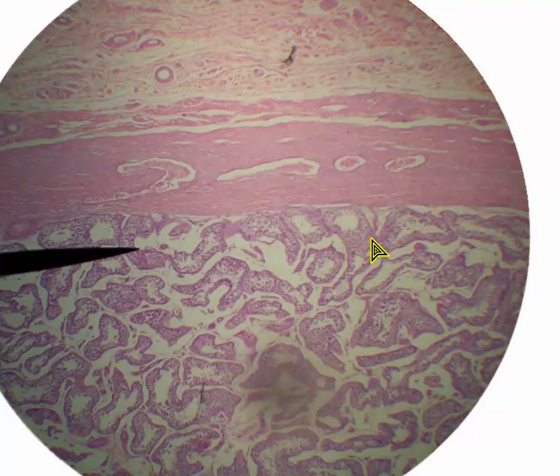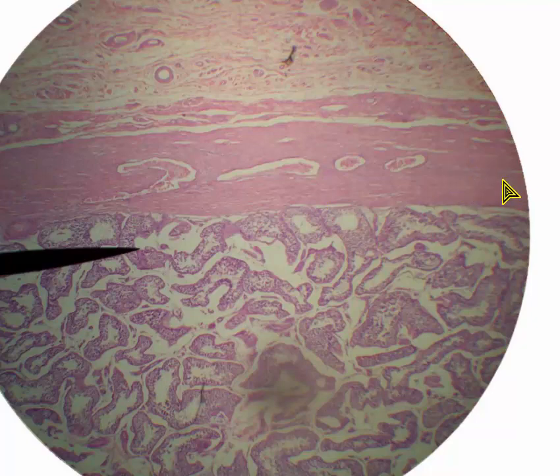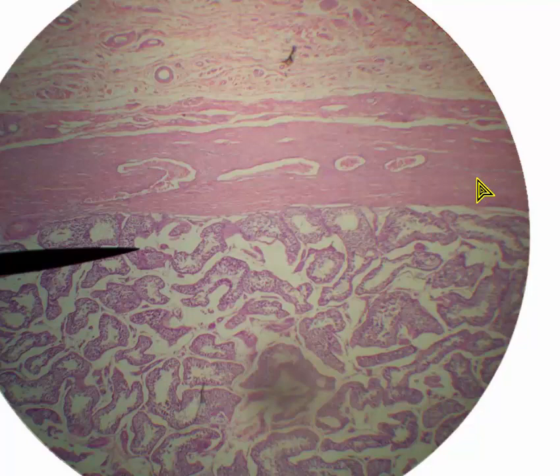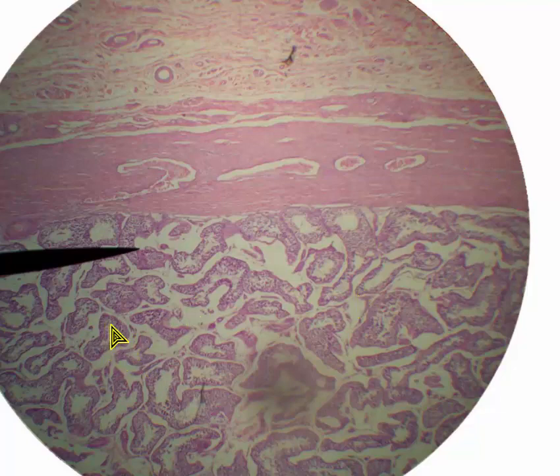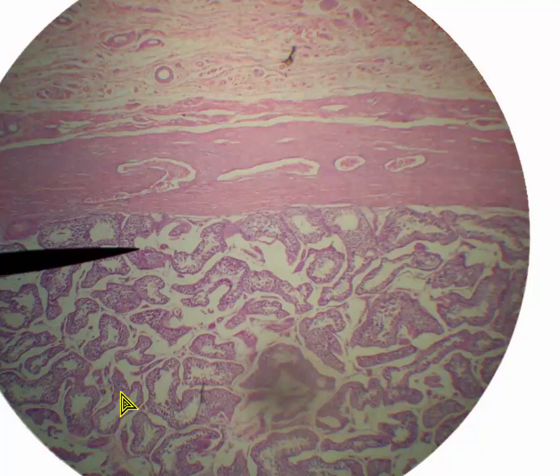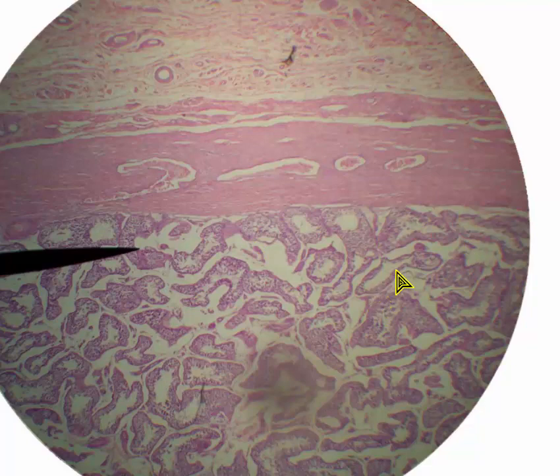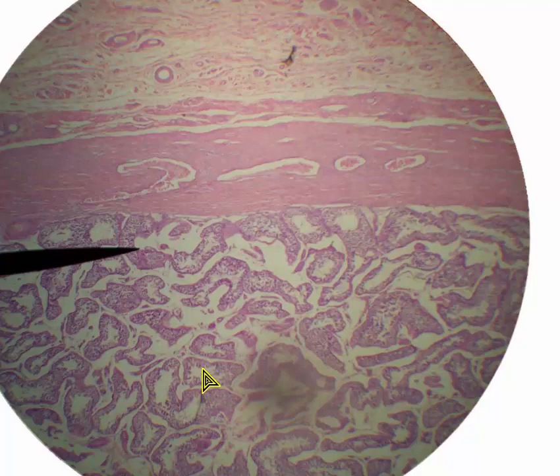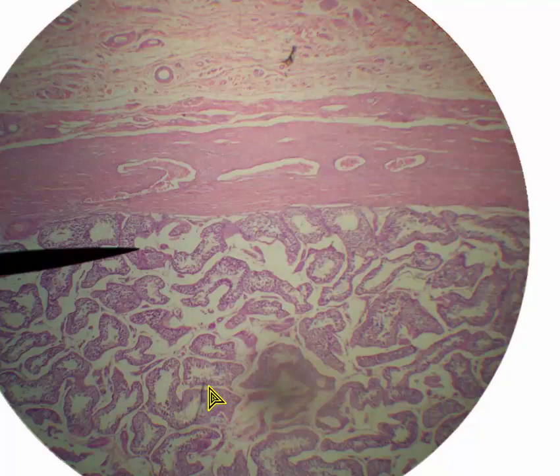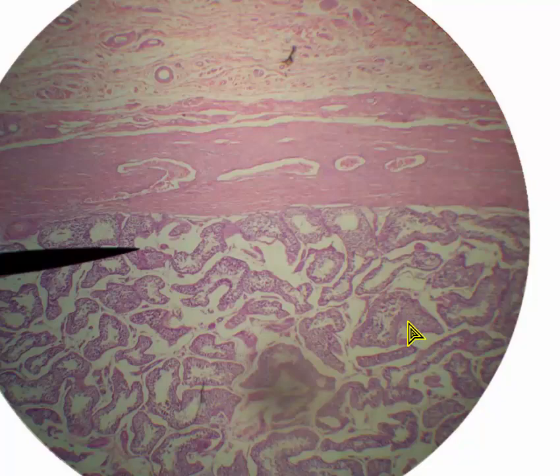We've moved away from the female — now we're into the male. This is a section of testicle. We're looking at the outer part of the testicle, which is surrounded by this dense irregular connective tissue covering called the testicular capsule. In this space we see the little tubes in which the sperm develop, called seminiferous tubules. Sometimes they are elongated, sometimes relatively circular, depending on the angle at which the slice caught them. Because these tubes are convoluted, you see all these different shapes, but they're all seminiferous tubules.